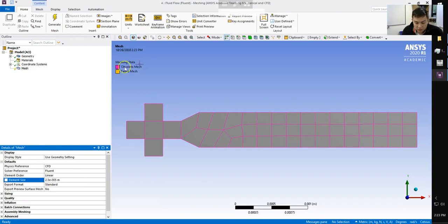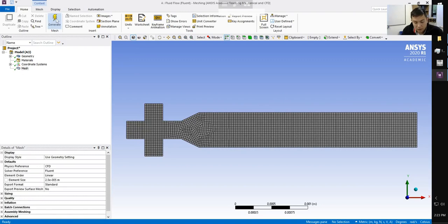And so now you can see again, we have an obsolete mesh, so we can go ahead and generate our mesh again. And now, just the default mesh comes through at a much higher resolution, which looks good.